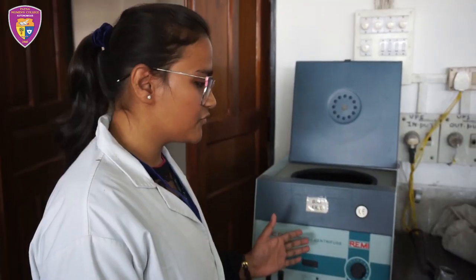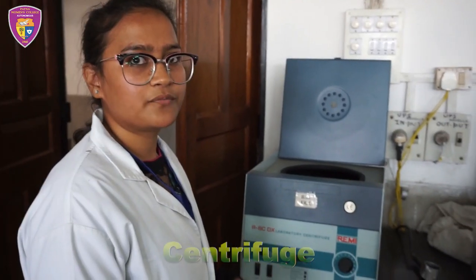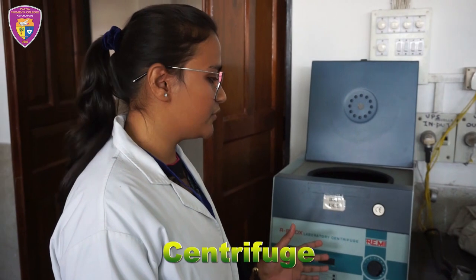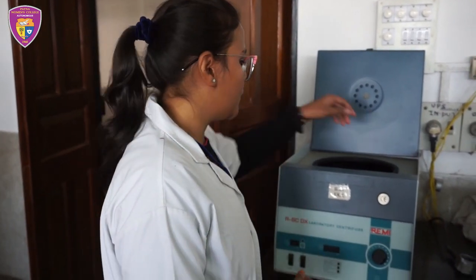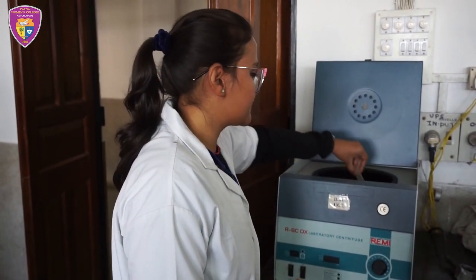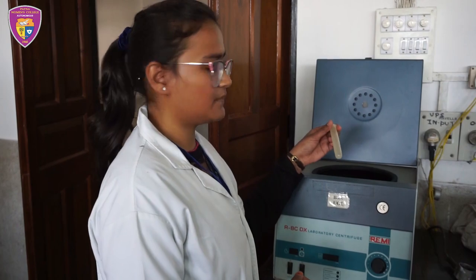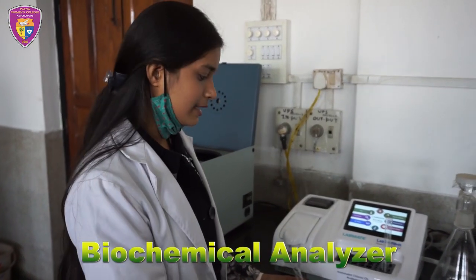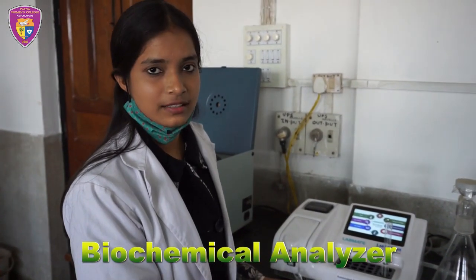A centrifuge is a device that works on centrifugal force. It works by moving the fluid at a very high speed within the container. Here we are extracting DNA from sheep liver.